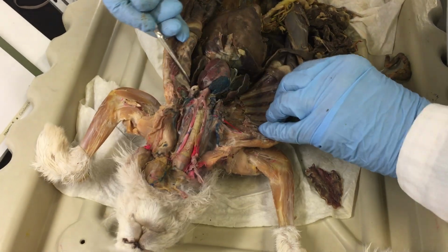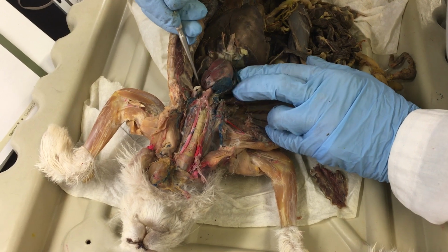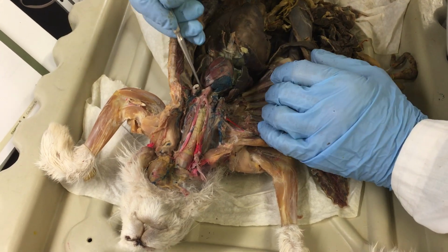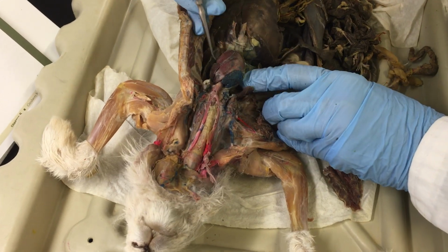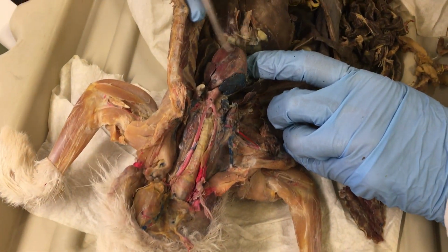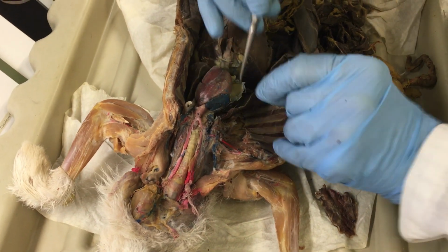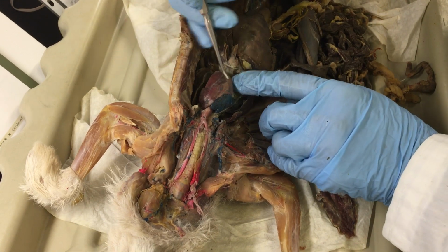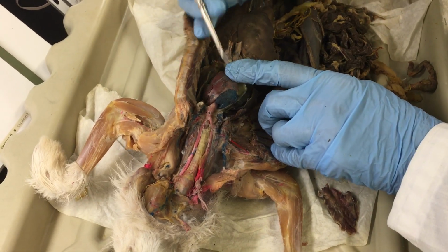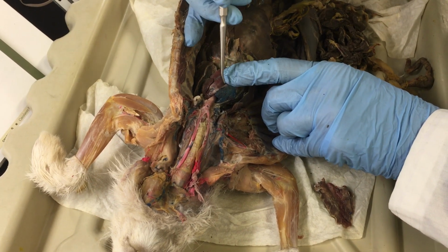In this section here, we're going to see most of the major vessels that come above the heart, and also some that come from below the heart. This one is the heart, and I took out the parietal pericardium. See the little membrane? So you can see that I peeled it off, right? And so on the muscle itself, or the heart muscle of the heart, you can see the two auricles that I show you in the model.